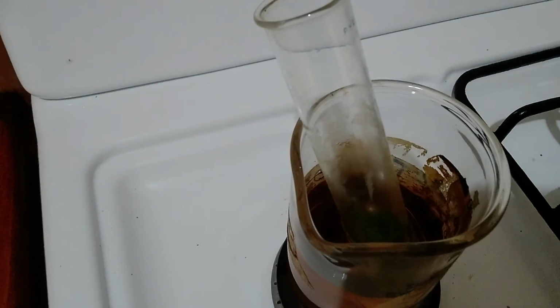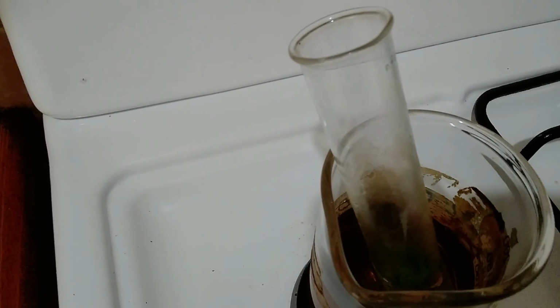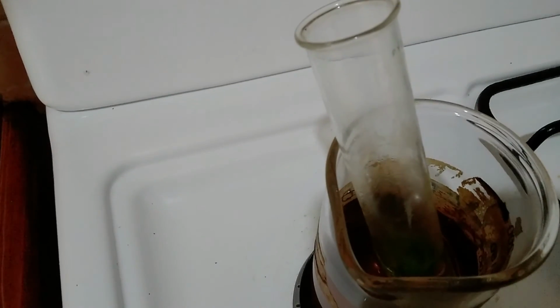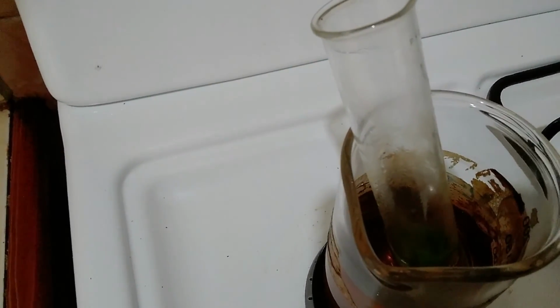We're going to be looking out for something. Remember when we looked at the variegated leaf, we said then that, from our observation, the alcohol started boiling. Let us see what will happen with this leaf.